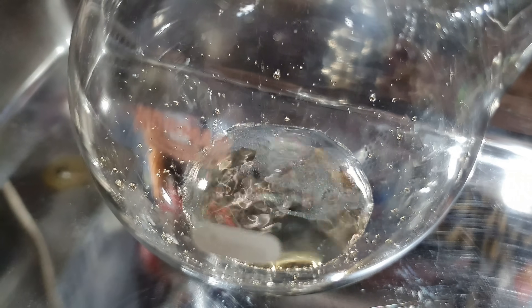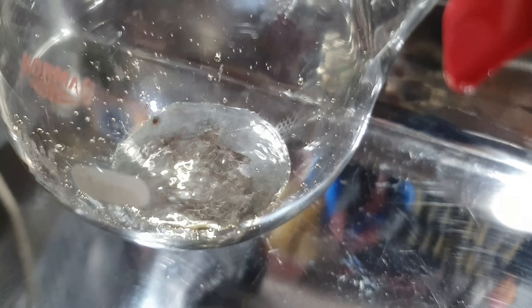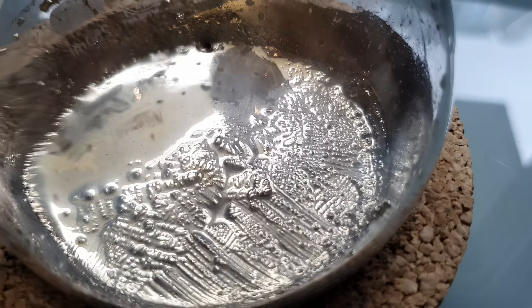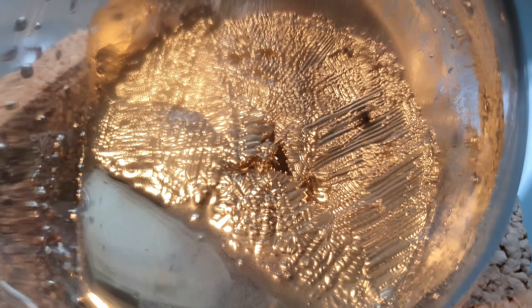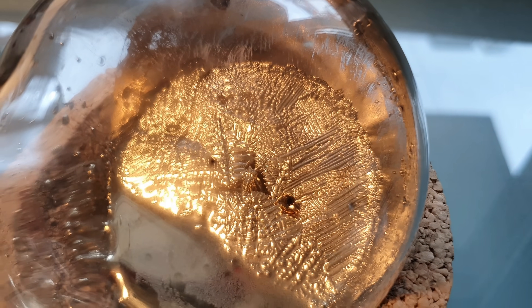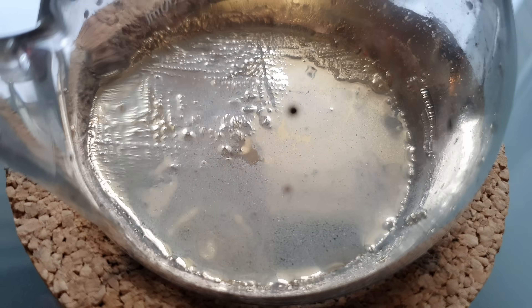The yield for my first batch was 85% — not the best yield I've ever had, but still very good. It was very interesting to see some dendritic crystals forming on the relatively impure cesium. I made a second batch and collected the cesium in the same Schlenk flask. The second time the yield was only 80%. Combined I had around 146g of cesium.